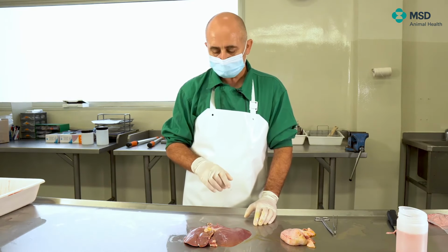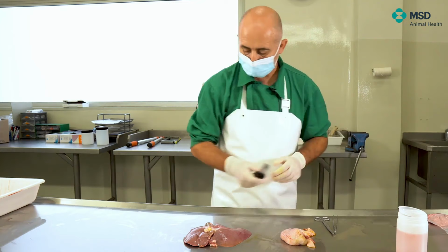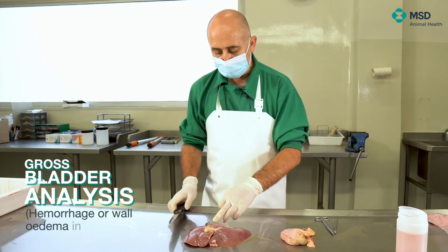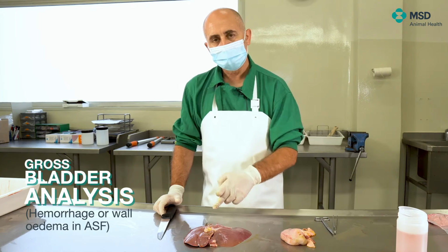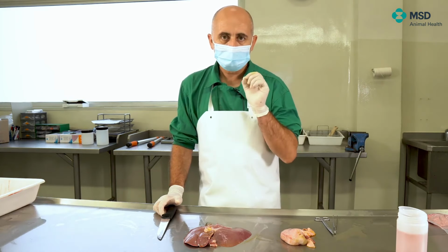First of all, the gallbladder itself. In fact, the gallbladder, as you can see, looks dark greenish, which is normal. But it's very interesting to know if there's edema of the wall of the gallbladder. Probably you have never heard about hepatic edema.